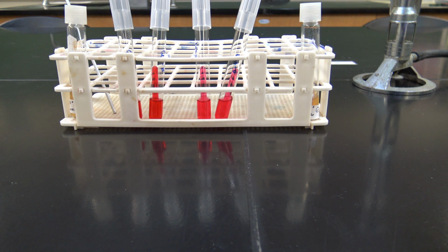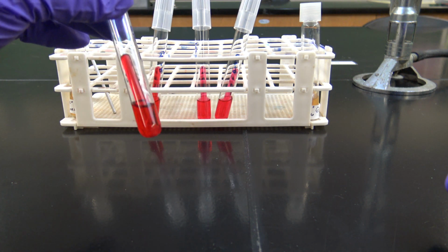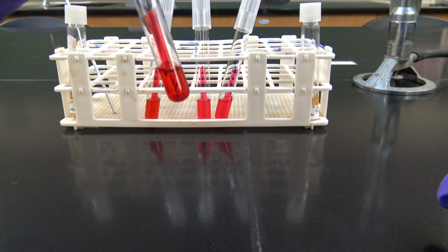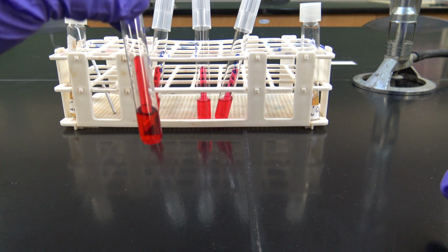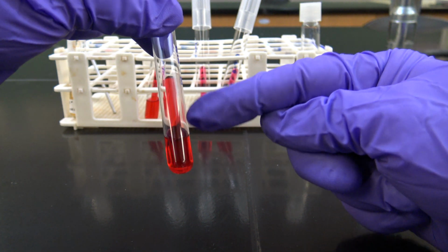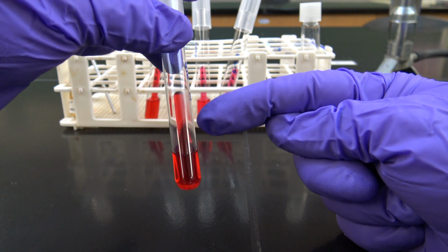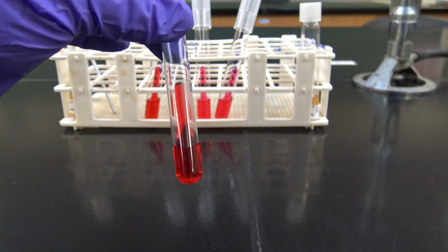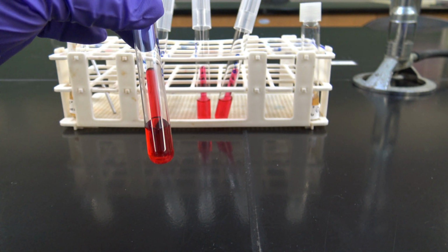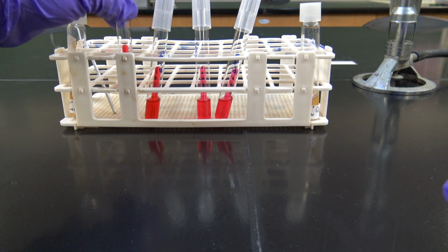So what we have here are phenol red broth tubes, and I just took out some of the broth here so you could see that inner test tube in there. That's called a Durham tube. A Durham tube gets filled up with the nutrient broth as well, so we can look for bubbles inside of the Durham tube, and that signifies that there's gas production when this microbe ferments a certain sugar. So we have glucose and lactose phenol red broth tubes.